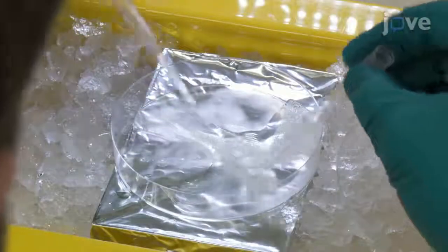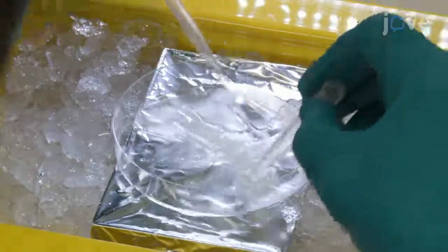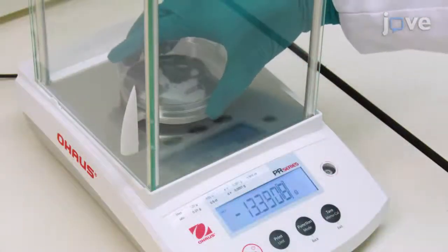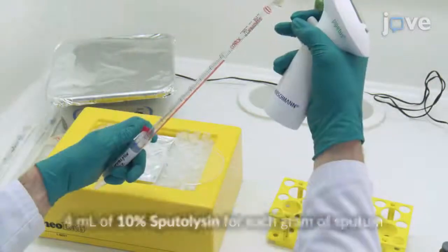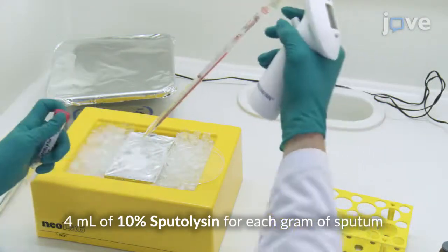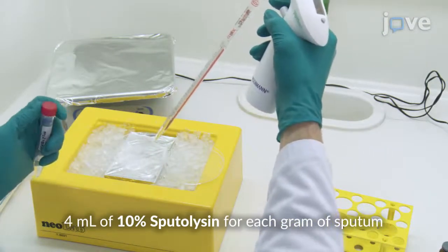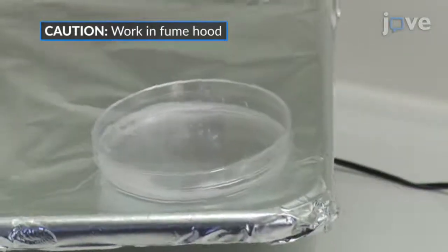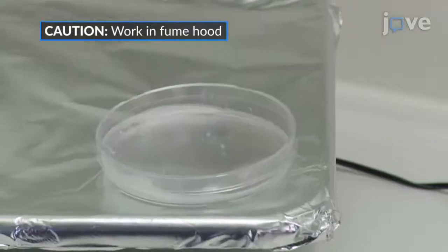Separate mucus clumps from the saliva into a petri dish with the help of a pipette tip. Weigh the mucus, then add 4 volume parts per weight of 10% sputolysin in PBS to the sputum. Incubate the mixture at room temperature on a rocking shaker for 15 minutes to dissolve the mucus.